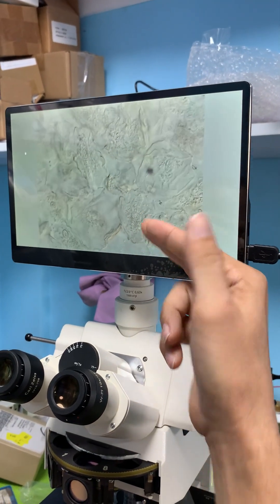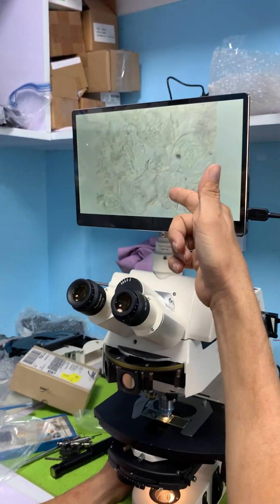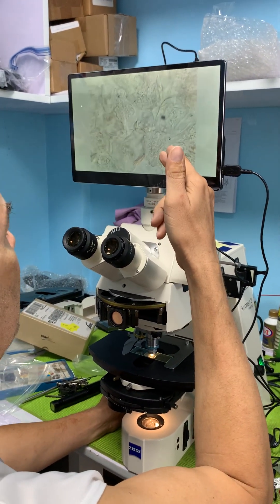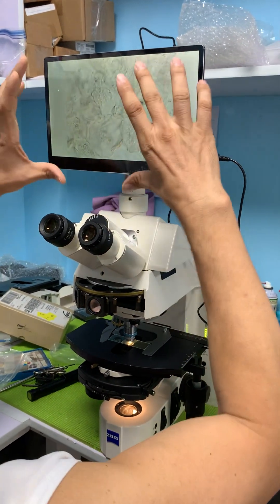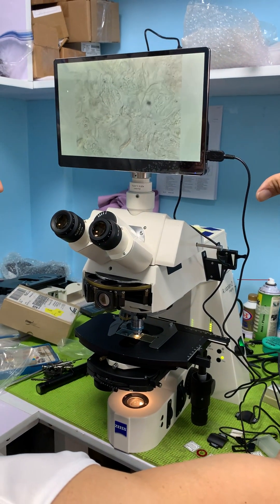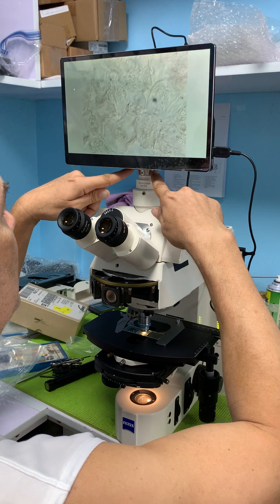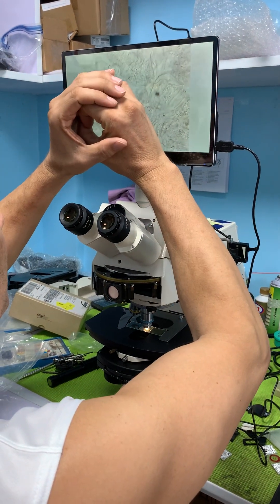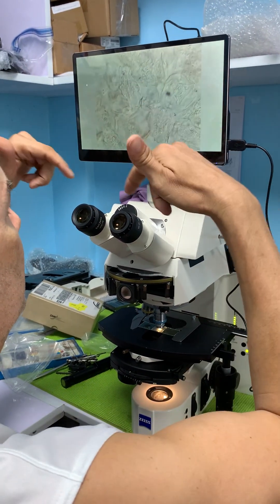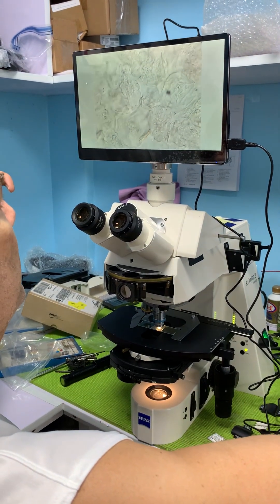These objectives are pretty parfocal — what I'm seeing in the eyepieces is pretty parfocal with the camera. The only difference is in the eyepiece I'm seeing a much wider view. The camera has a small chipset, so it has a very small field of view, whereas in the eyepieces it's a much more beautiful open view.